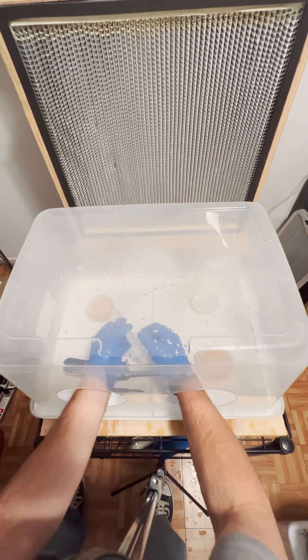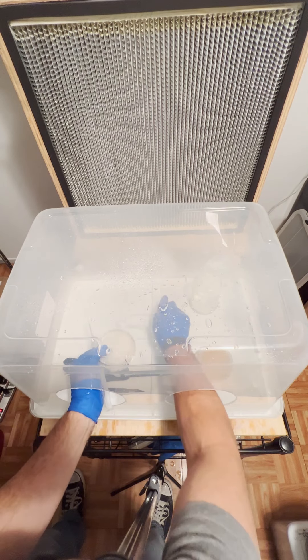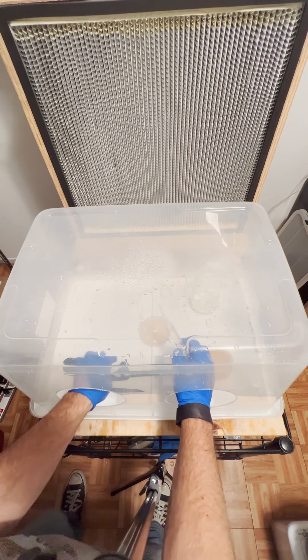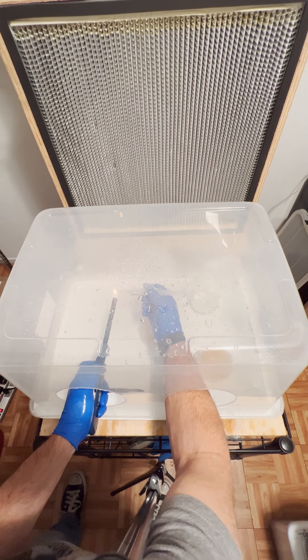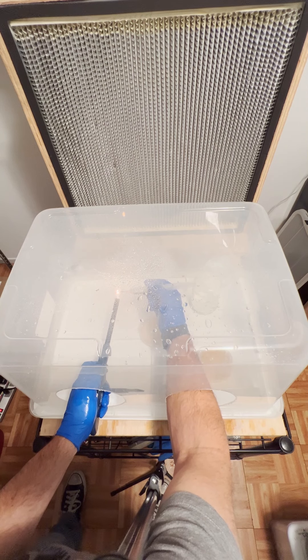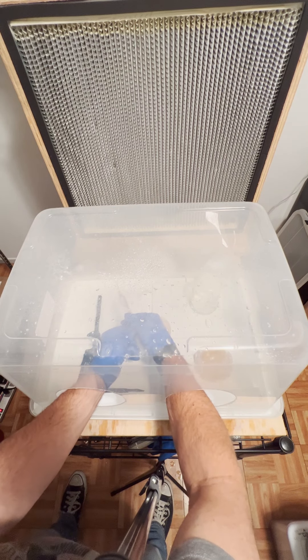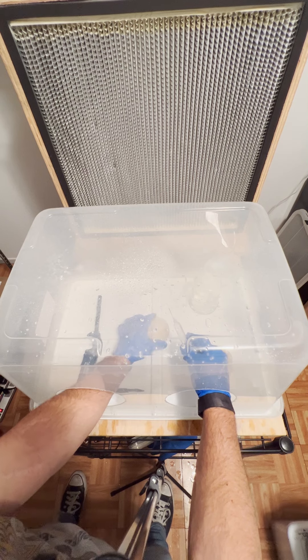First I'm going to work with my spores — there's no particular reason I'm going in this order, that's just where I'm starting. I want to use a flame to sterilize the tip of the needle. I'm waiting for that flame to get red hot. Before I started this video, I gave these spores a really good shake — so before you do anything with spores, make sure you shake them up real good. This particular strain is in very clear water and it's really difficult to see the spores; there's no visible black spore clump. All we're looking for is a couple of drips of spores right onto the agar plate, and we're done with it.